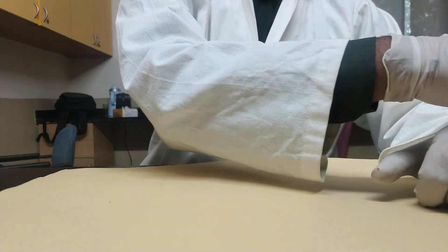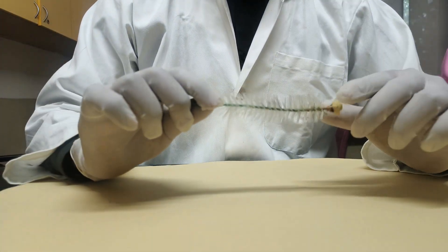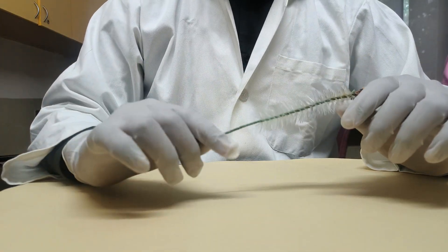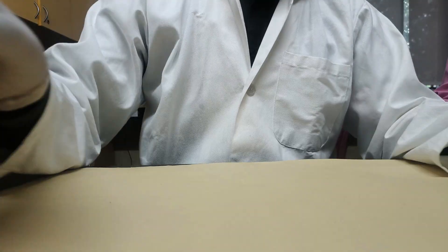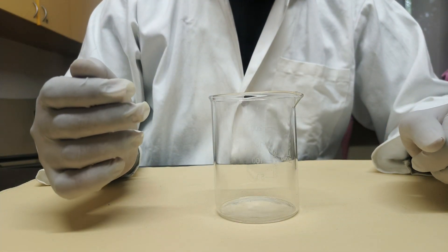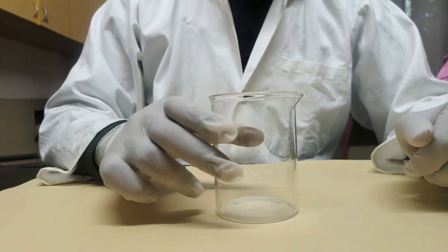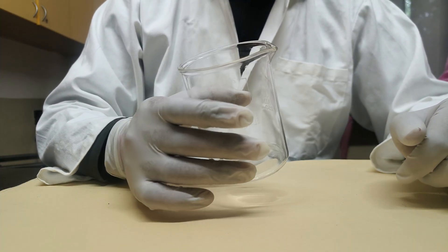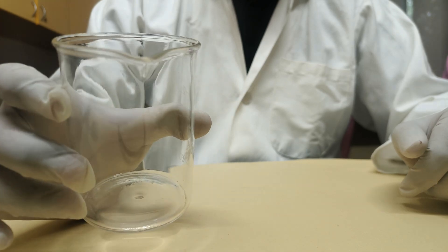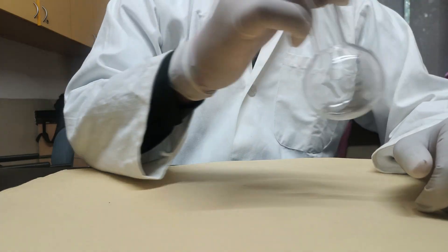Next is the test tube brush. It is used for cleaning the test tube from the inside — it is very accurate for cleaning them before use. Our next item is the beaker. It has a beak, so it is called a beaker. It is used to hold liquids, with measurements in ml as an approximate measurement.